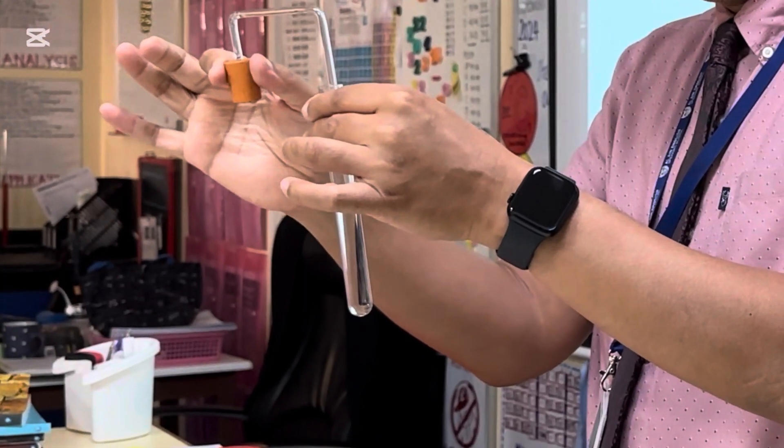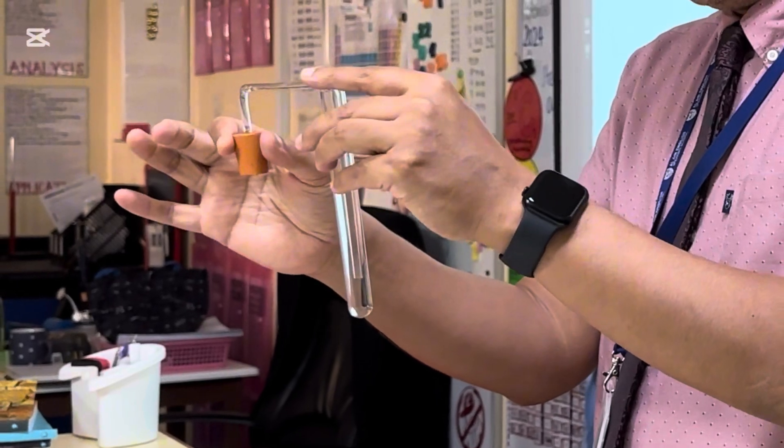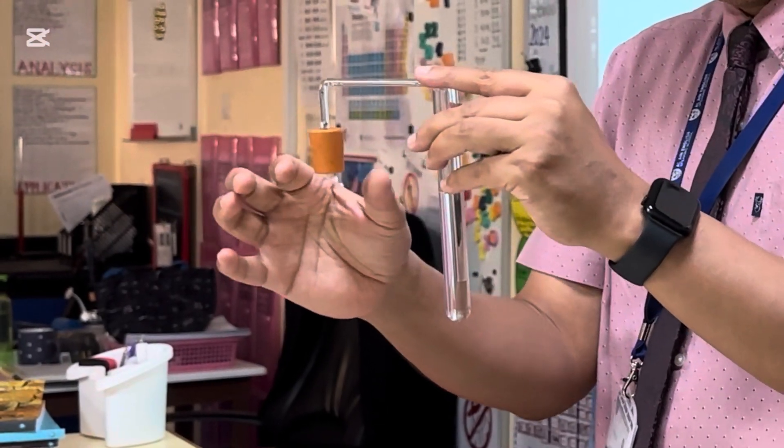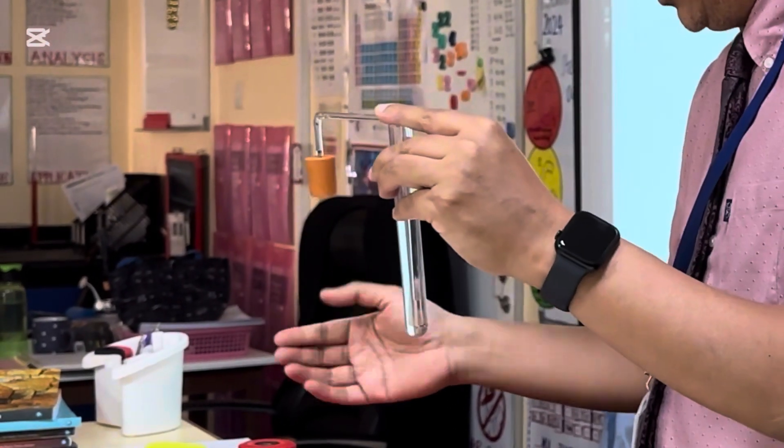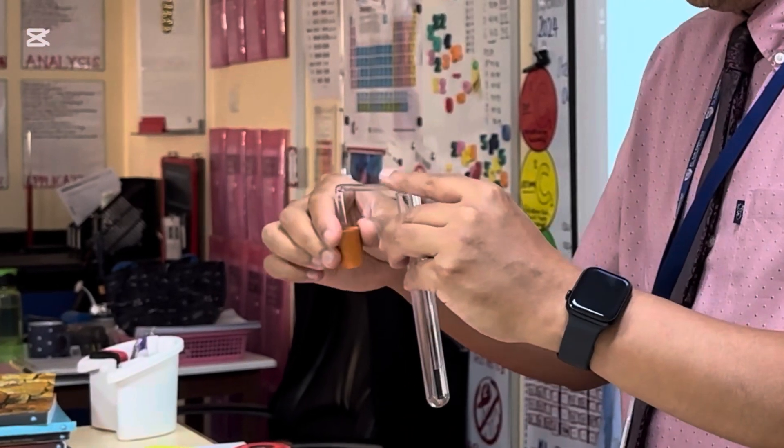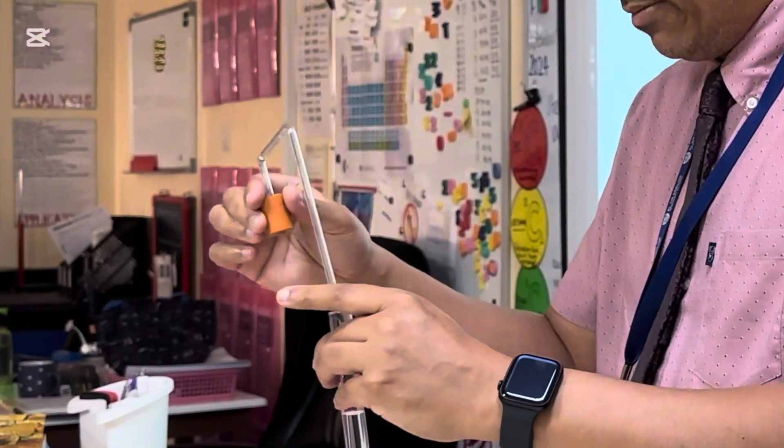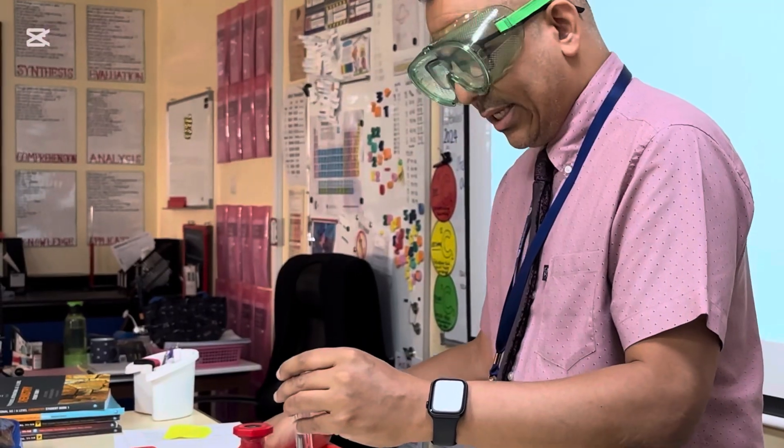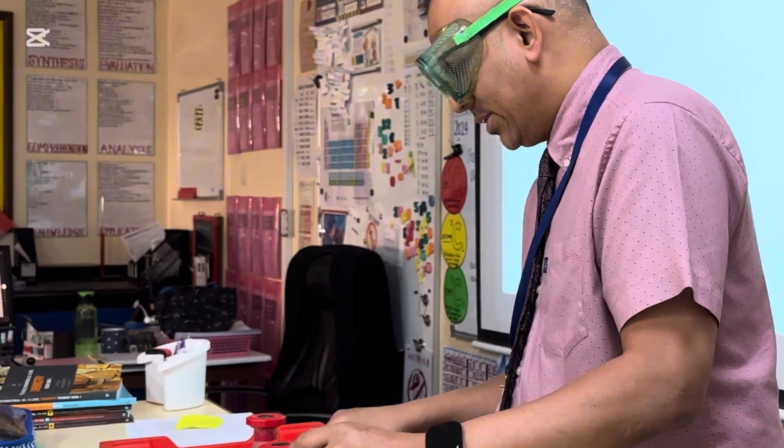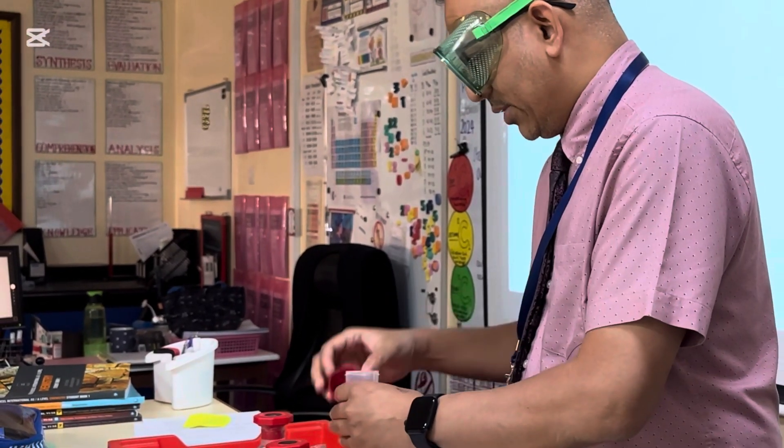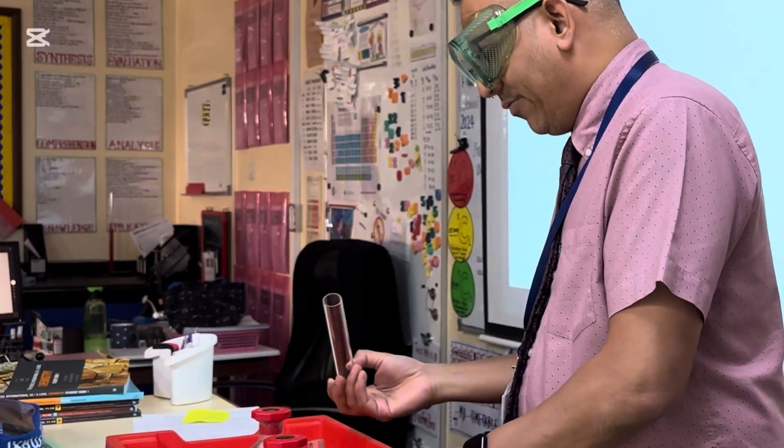So today what we're going to do is I'm just going to have a quick look at how to test for the gas carbon dioxide. In another video that I have on the channel we actually made the carbon dioxide. I certainly realized earlier today that I actually need to perhaps show you what the test is. Now this is actually another reaction all together.